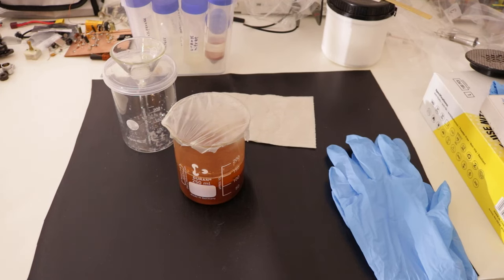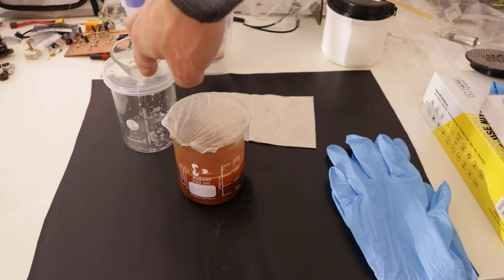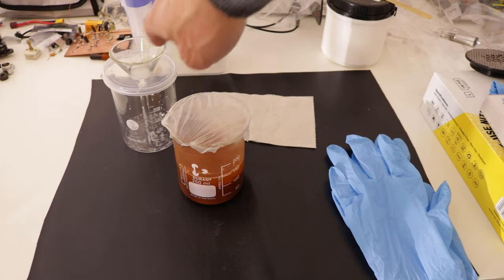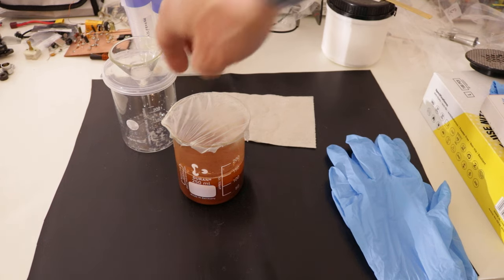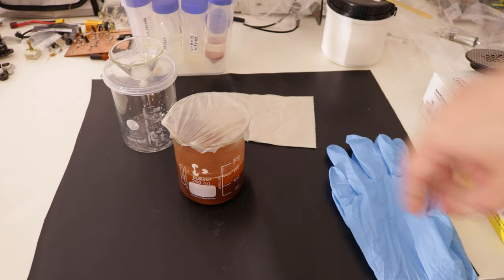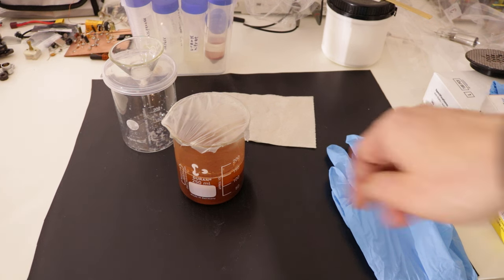Now I'm going to remove the top layer that's clear and filter it with this gravity filtration setup. I unfortunately don't have anything for vacuum filtration. I'm going to add a bit more water, let this settle out and repeat until I have hopefully washed out all the uranium that's in there.